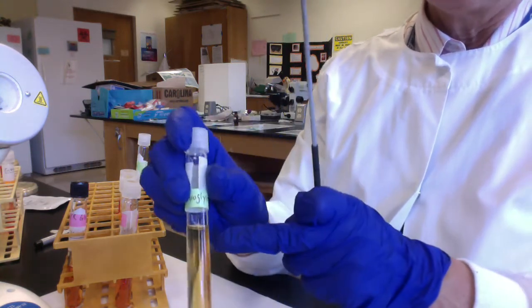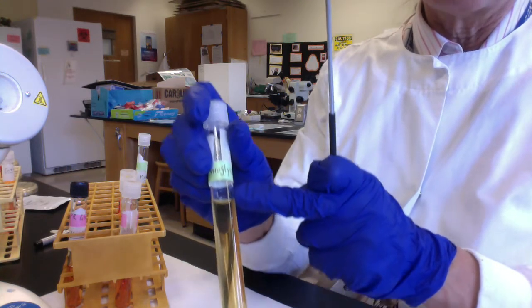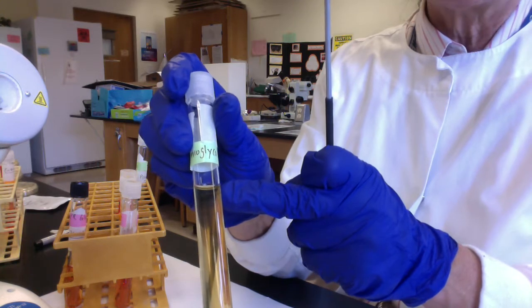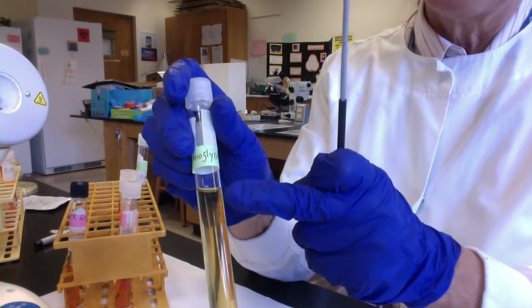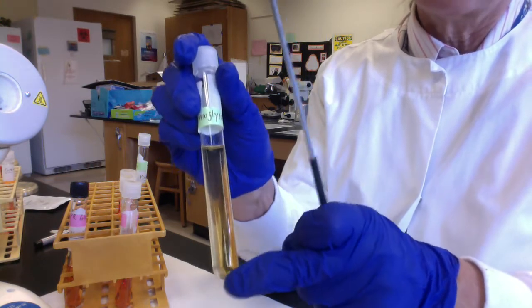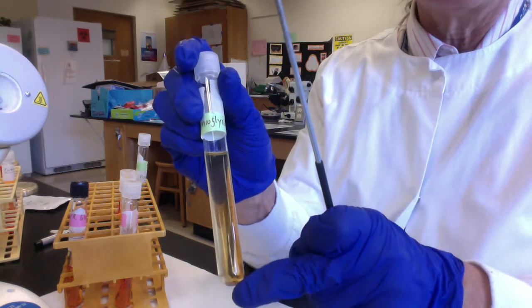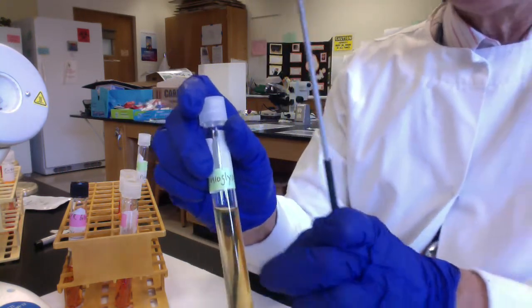Okay, we would presume that up at the top, at the air-broth interface, there would be a little oxygen present. And indeed, folks, we have an oxidation-reduction indicator present, and it's green when oxygen is present. But you can see down below here there's no green. That's telling us this is an anaerobic compartment. Again, the thioglycollate has reduced the molecular oxygen, so we have a nice anaerobic compartment here.